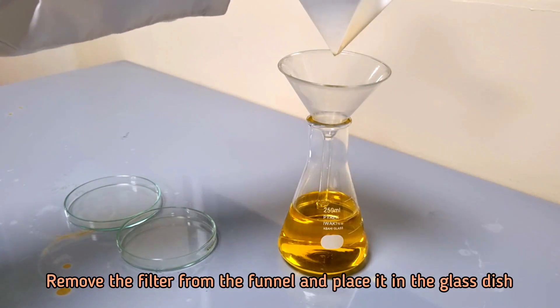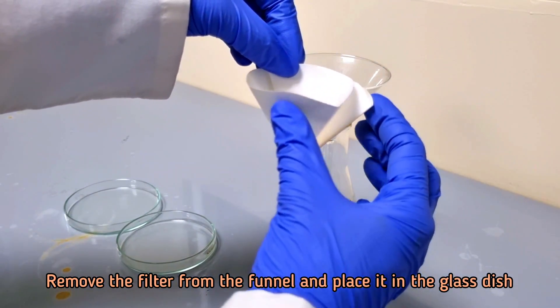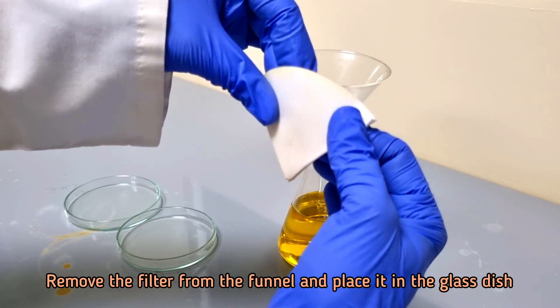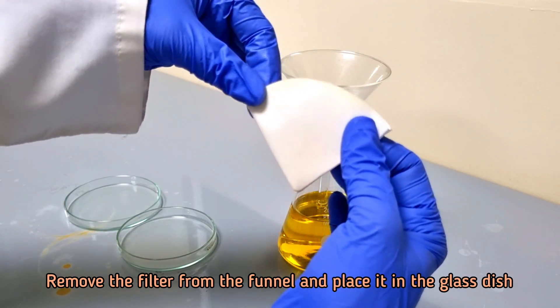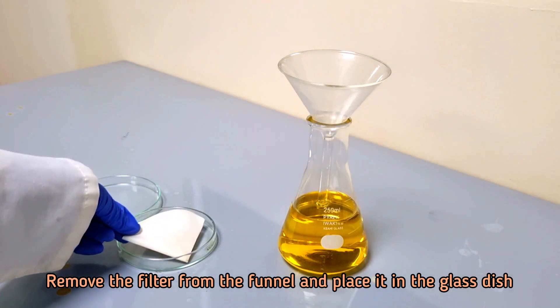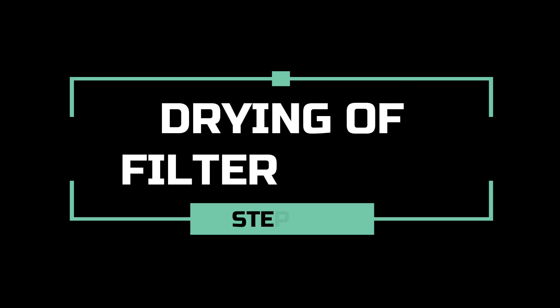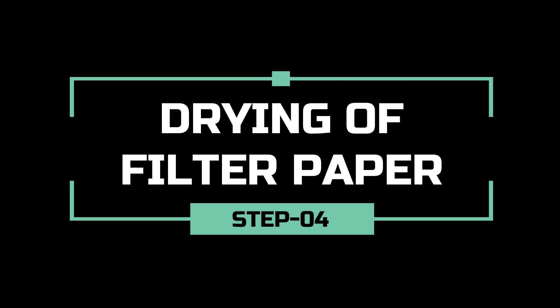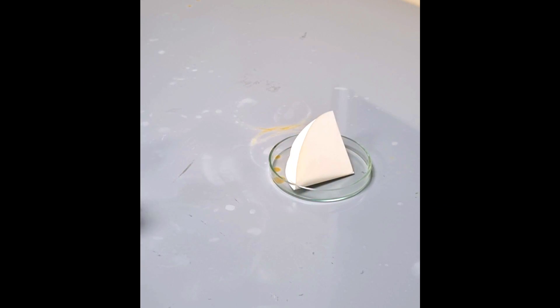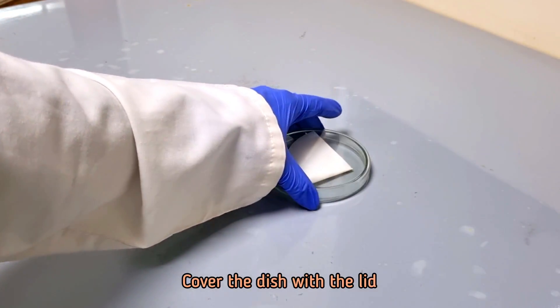Remove the filter from the funnel and place it in the glass dish. Cover the dish with the lid.